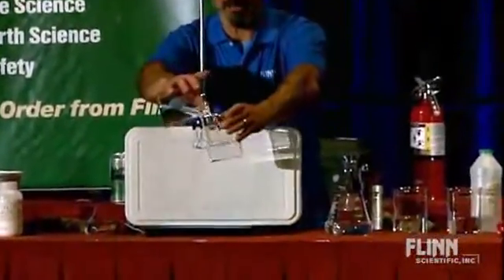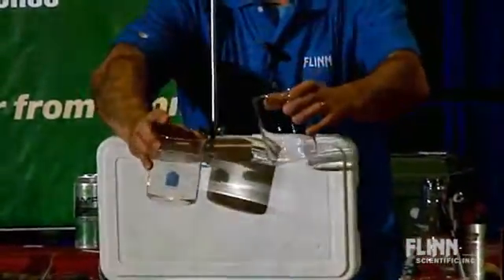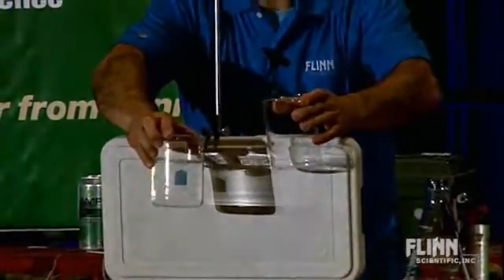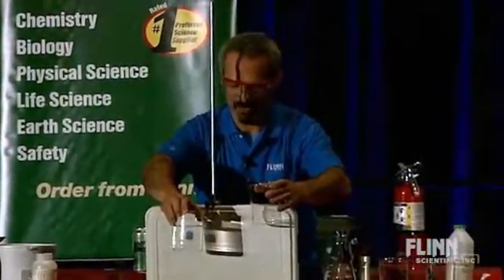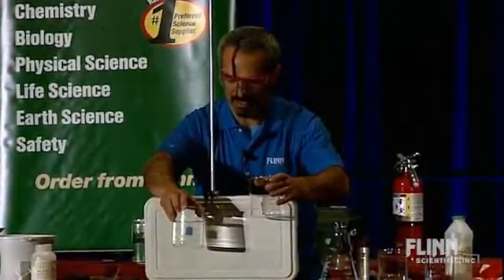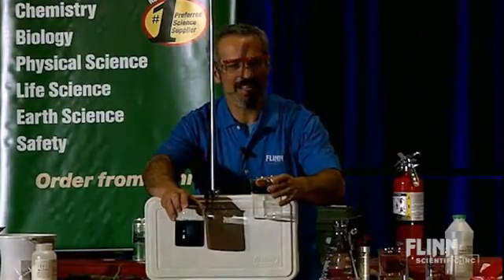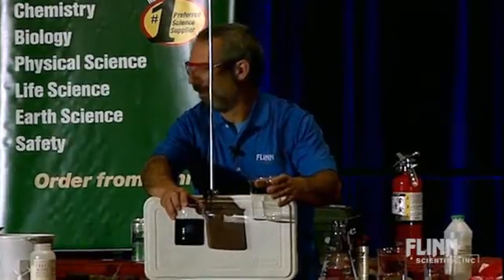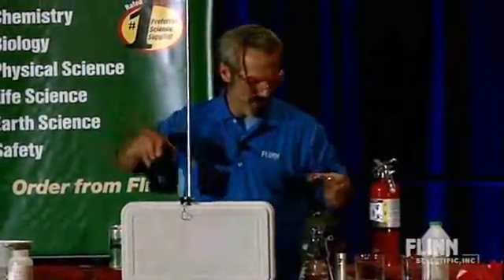You can make your predictions. Did I pour A into B or B into A? I don't remember — I never get this right. A lot of you had looked away. Yeah, this one's not working, huh? Talking to your neighbor there. So I'll do it one more time.